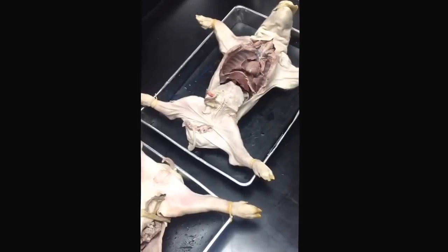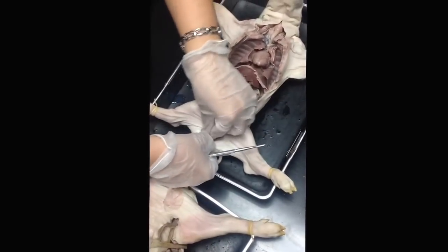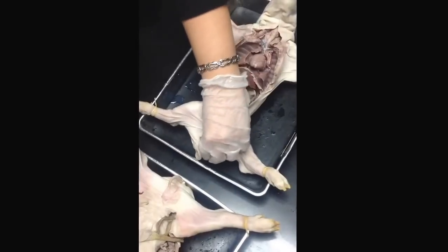Not you. Okay. You do it. So usually I start out by tucking this guy in. Let's go back to square one. I can't. You fished him out completely. There he is. No, it's okay.